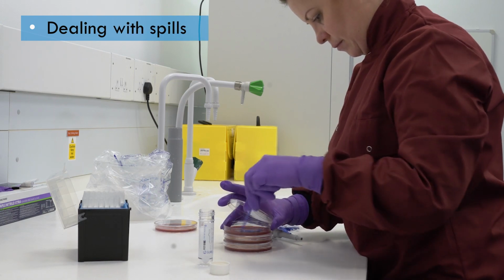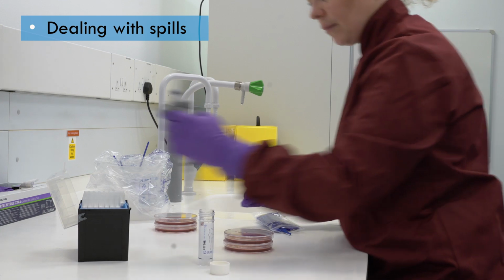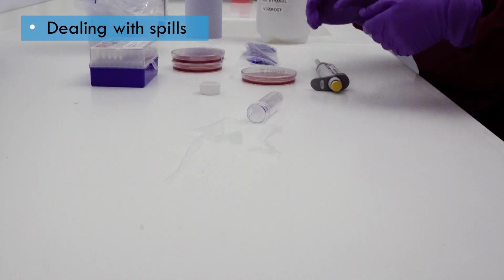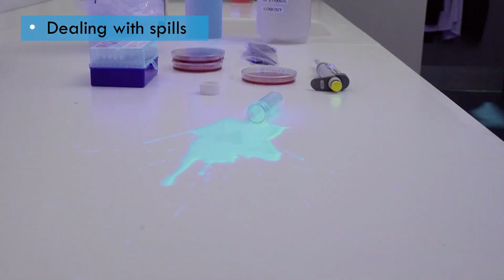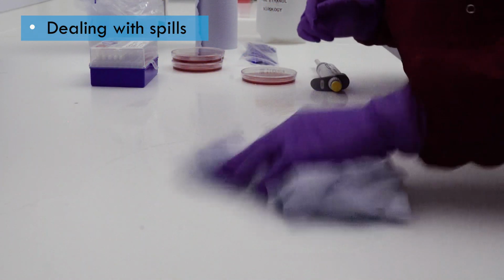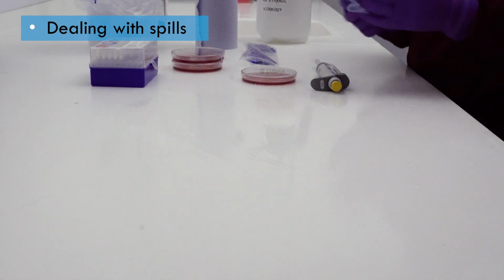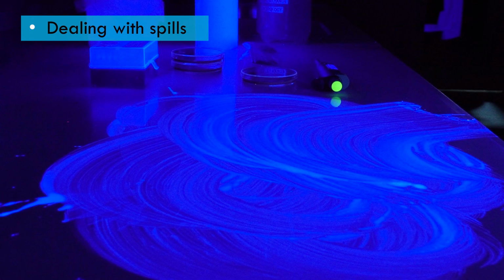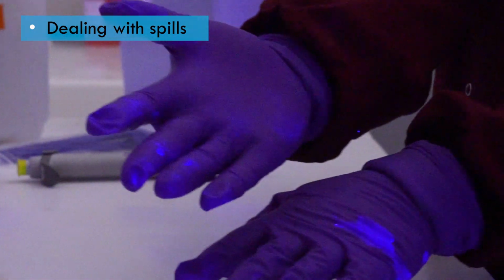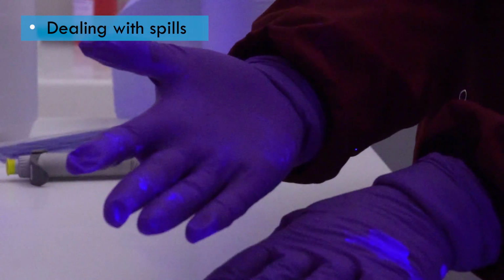Even if good microbiological practices and procedures are in place, spills will occur. A spill may appear to be very limited, especially when it's a transparent liquid. Here, switching to UV light activates a dye in the solution, which shows us that it has splashed out over a much wider area. Cleaning up the spill might seem a quick and easy job, but the UV light shows that a lot of contamination has been left on the bench and the gloves. You must always wear appropriate gloves for dealing with a spill, and these must be changed for fresh gloves before resuming work.